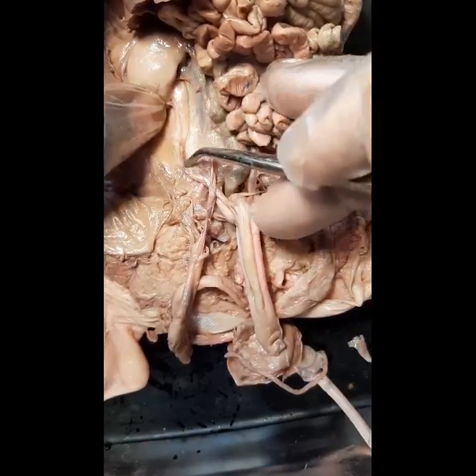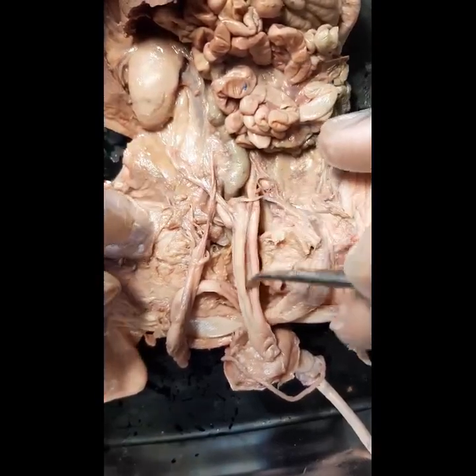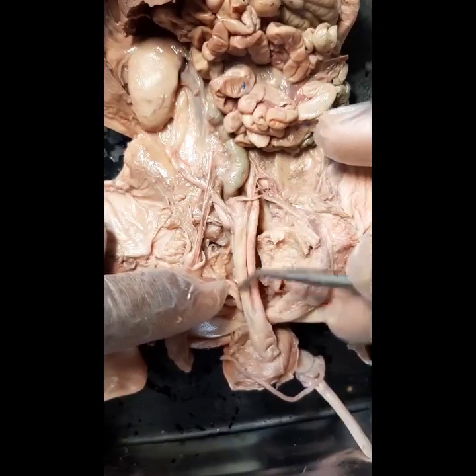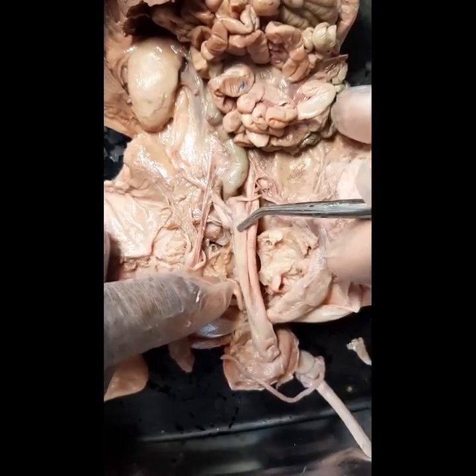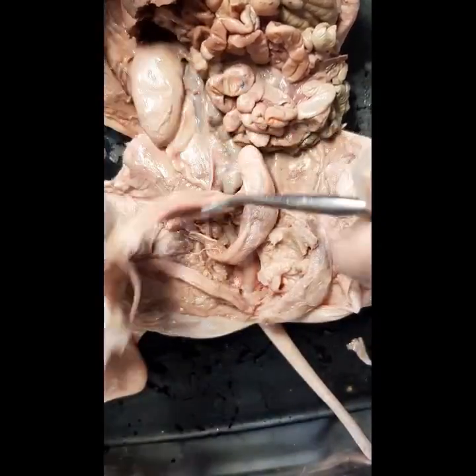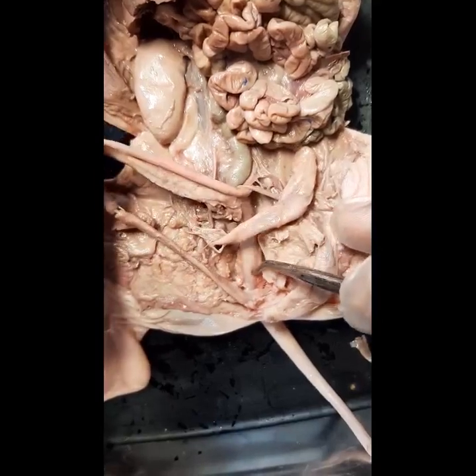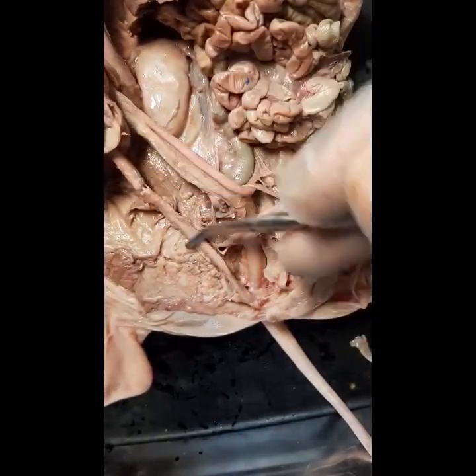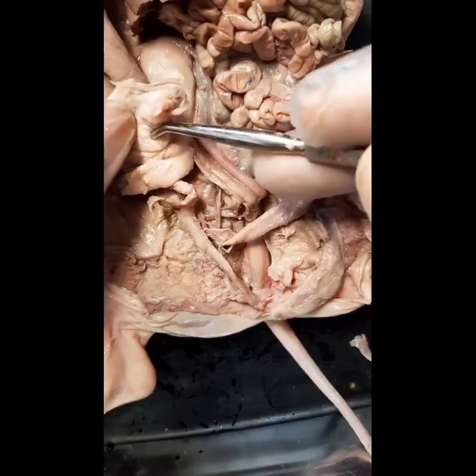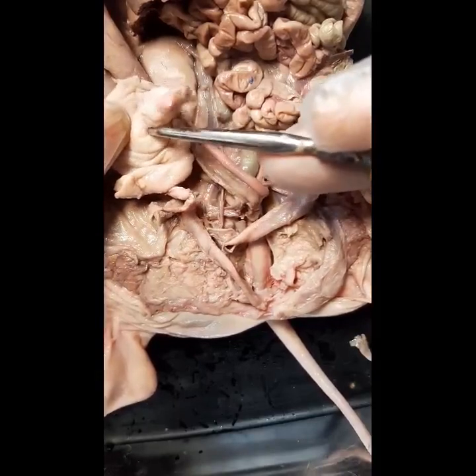And then we have the ureter. From the ureter, you have the bladder — this muscular structure is the bladder. From the bladder, urine would go through the urethra into the penis. This long part here is the penis, and out through the urogenital opening.